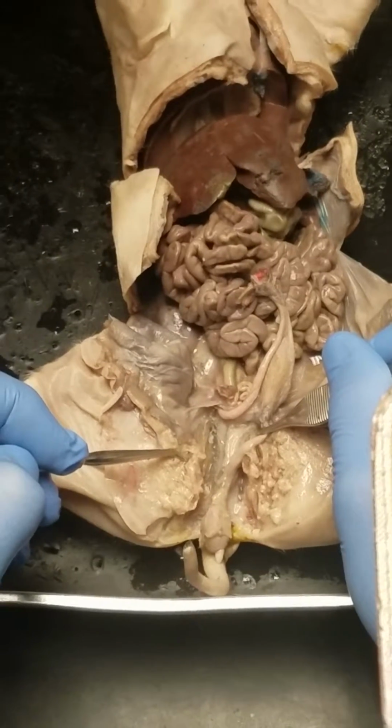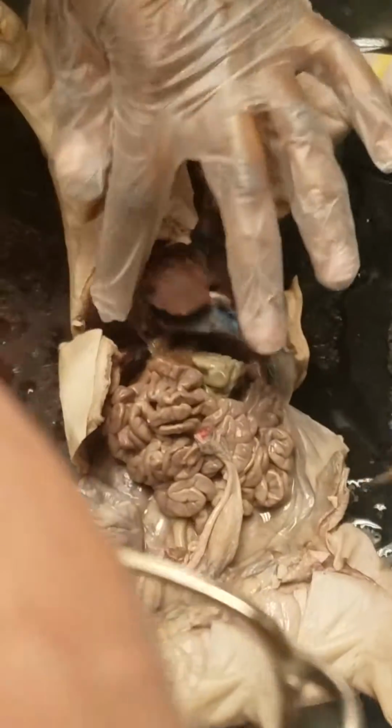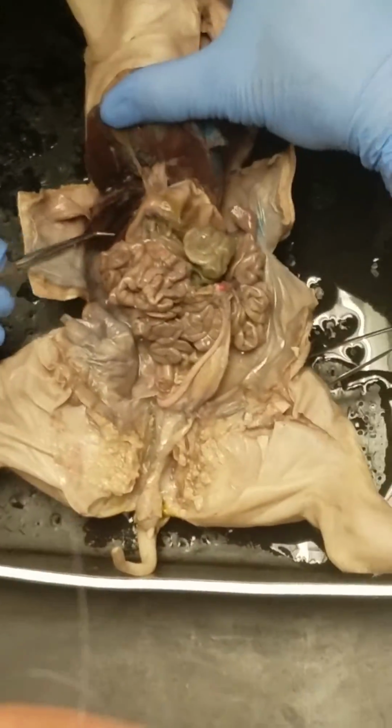Oh dear God, now I'm asking, do pigs have periods? Can you give me this part in here again? Right here. All right, so this one's nice. Got to get a good lighting though.